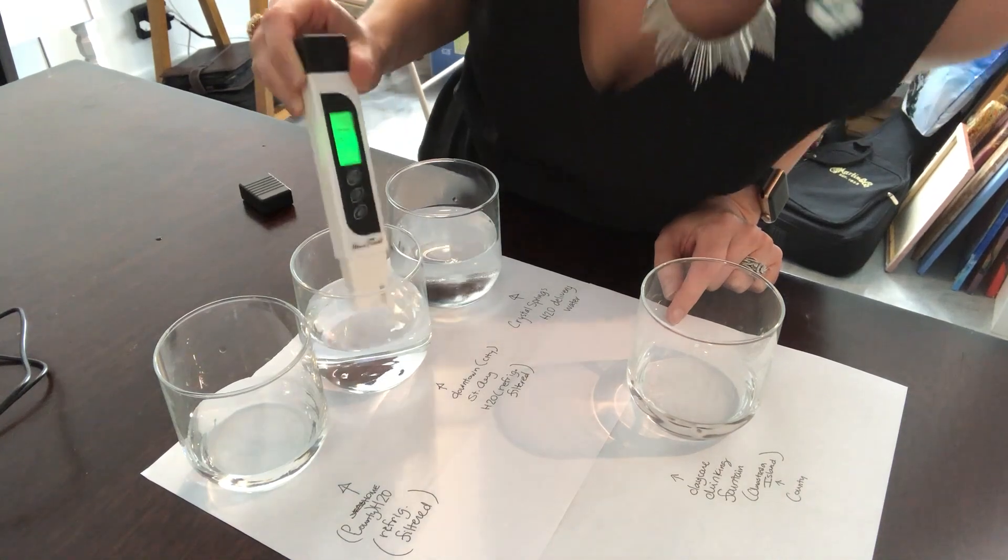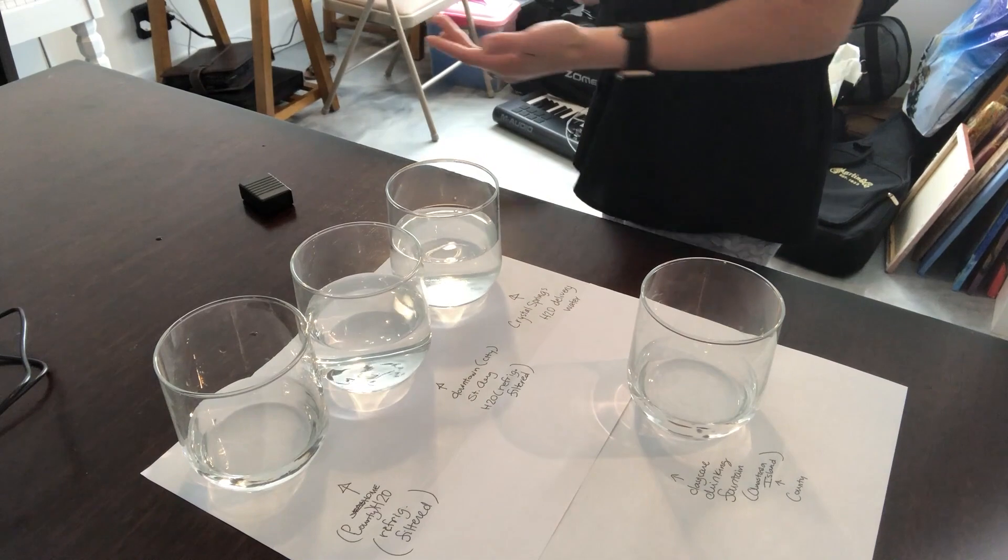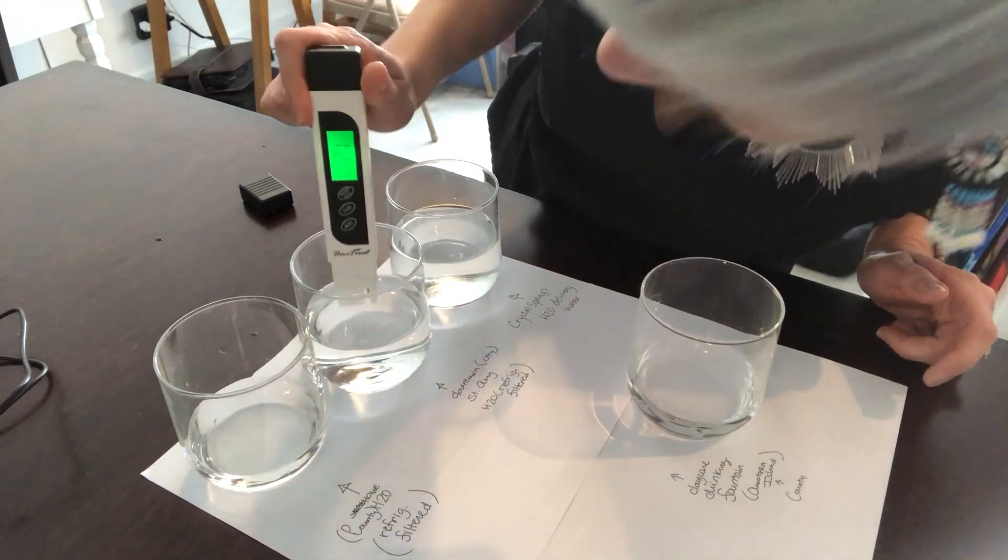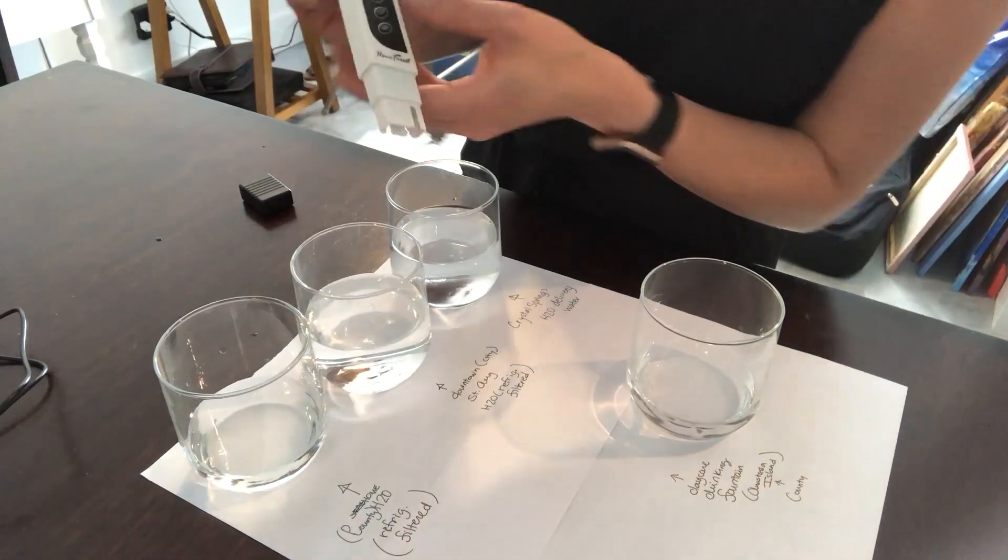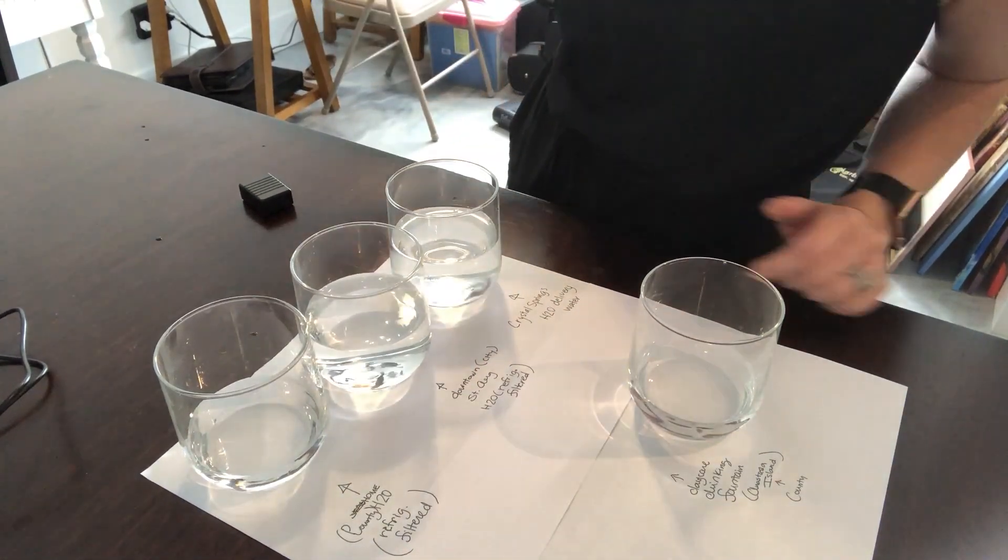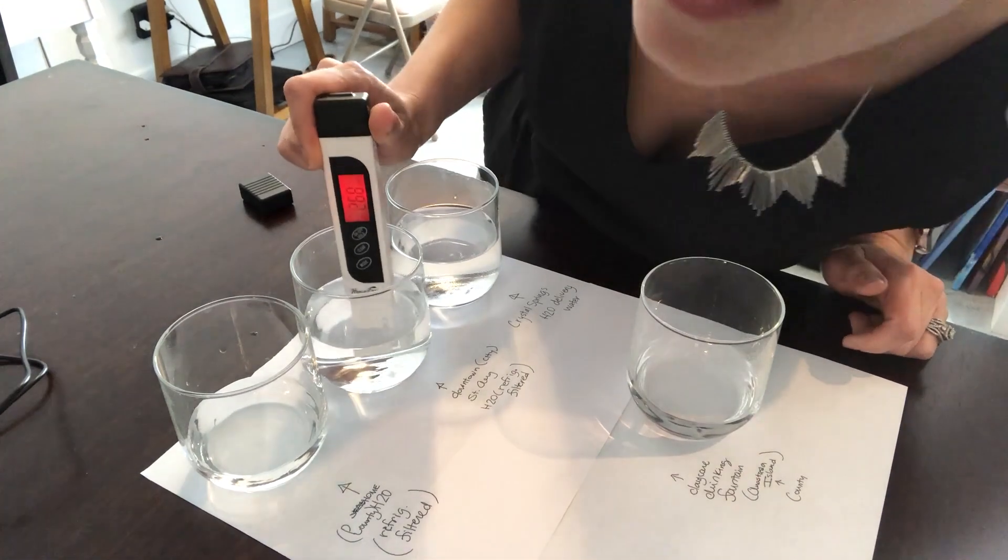I didn't test this before the video but it's not changing, so I'm gonna try clearing it, making sure it's reading correctly. Oh, okay.